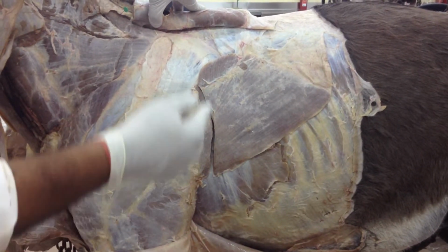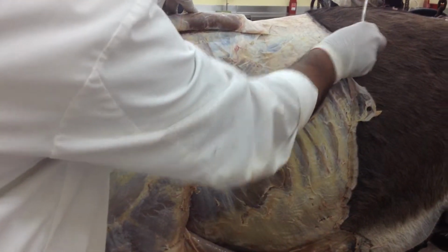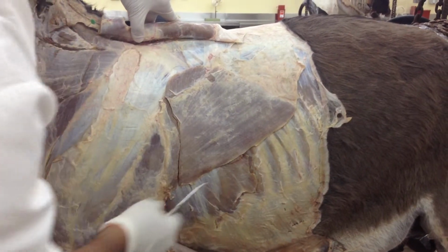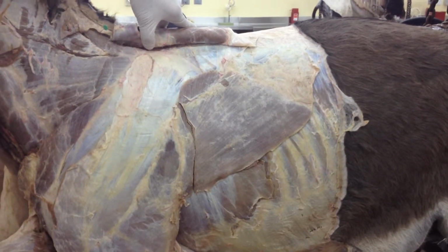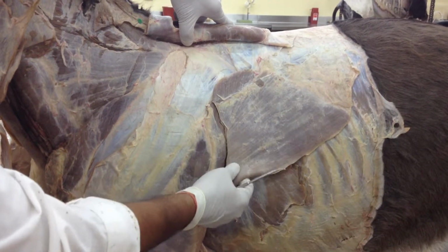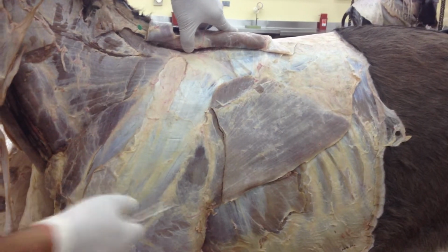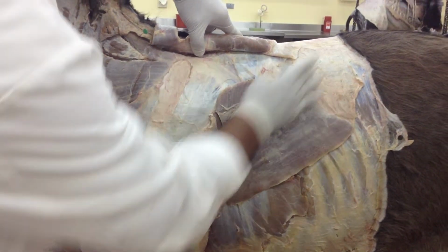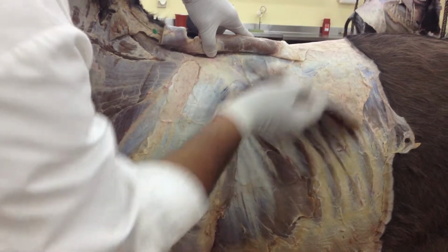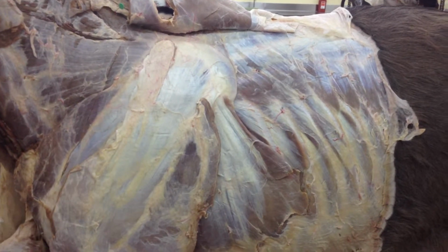lesser tubercle of the humerus and then inserting on the thoracolumbar fascia. Okay, not lesser tubercle, but the teres tuberosity of the teres major as well as your cutaneous trunci, and these muscles that would come from that. Okay, from the humerus, from the teres tuberosity, and then it would move further into the thoracolumbar fascia. We also reflect that one, and we expose some other muscles of the thoracic wall.